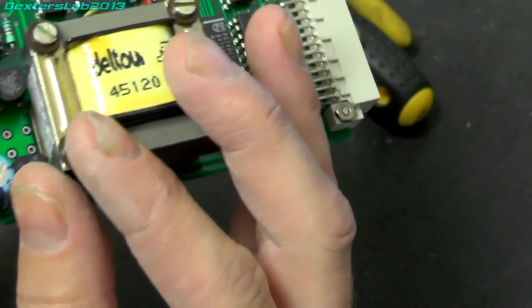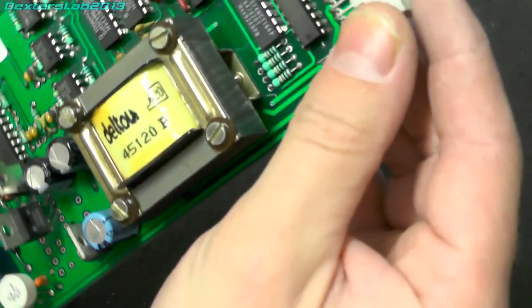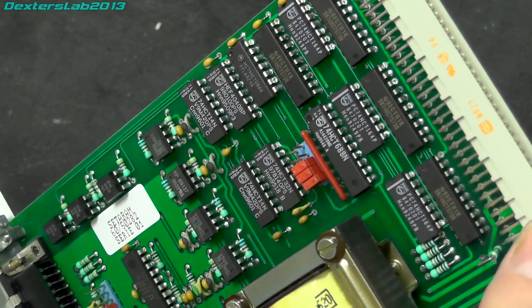What's that? LM340. So yeah, a little bit of local voltage regulation, and the rest of it is just 74 series logic.